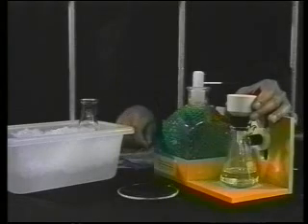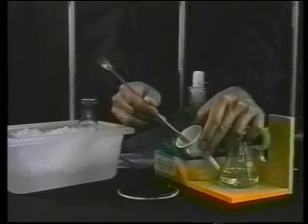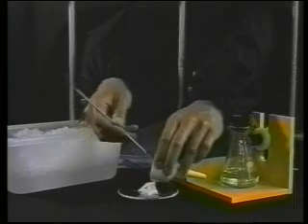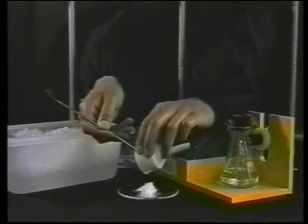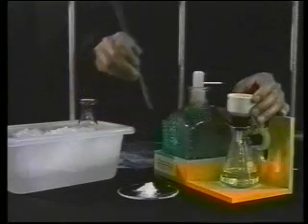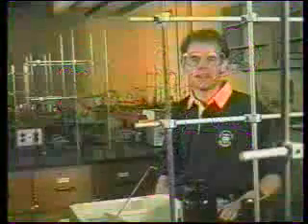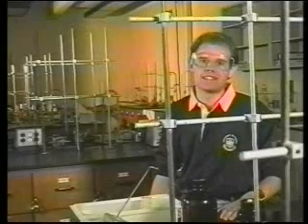Remove the Buchner funnel and use a spatula to transfer the crystals to a watch glass. Any boiling stones which remain from the crystallization procedure may be physically separated from the crystals. Once the crystals have air dried, the product is ready for characterization. This recrystallization worked well. Now, let us again review the steps in the recrystallization process.